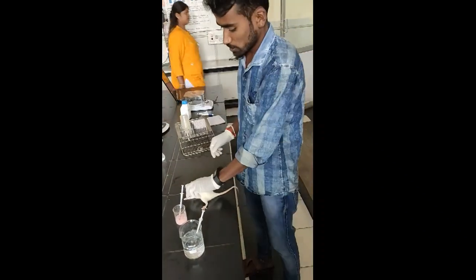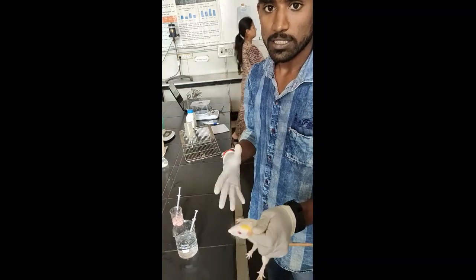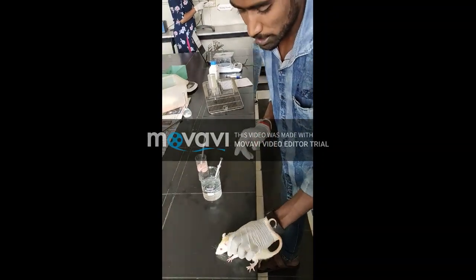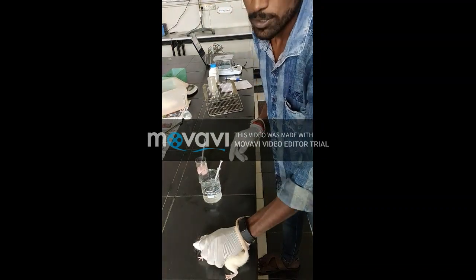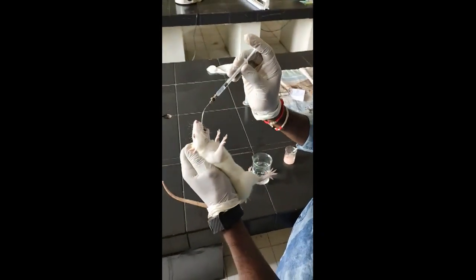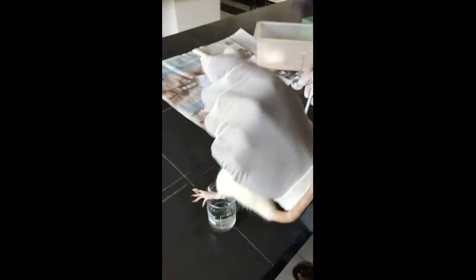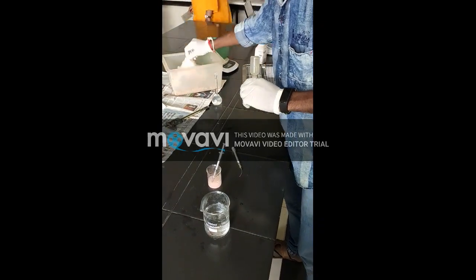This is the normal group. I am giving 2 ml per kg body weight as the standard volume. I am giving 0.3 ml water by oral route. After dosing, we leave it for 1 hour, then we will give the carrageenan dose.